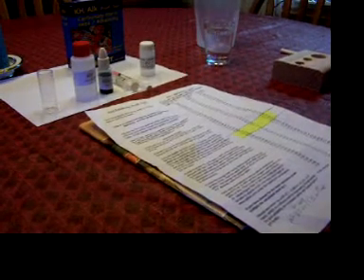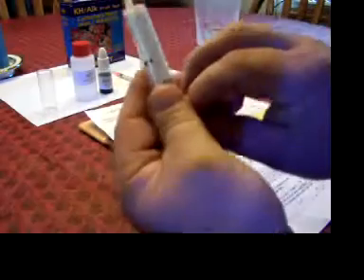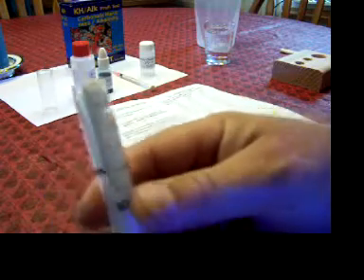So let me get started here. I got a little bit of water out of that tank a little while ago. And let's test it and see how much carbonate hardness alkalinity we have into the tank here. First thing you do is you take this syringe and you fill it up with four milliliters of water out of the tank.